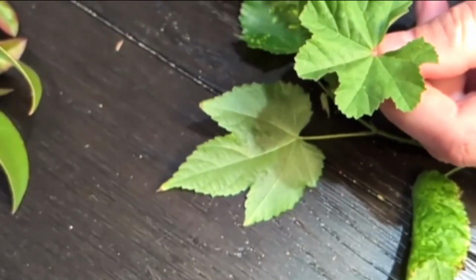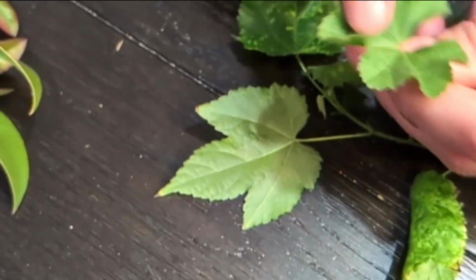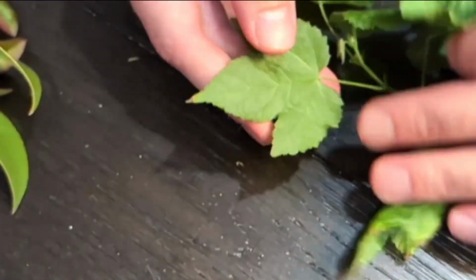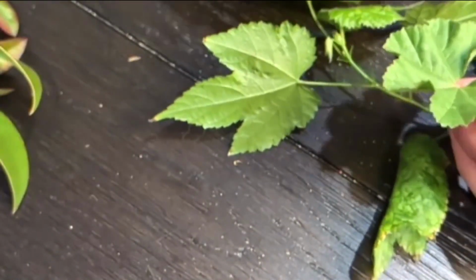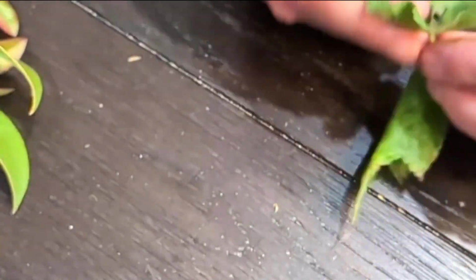It's not compound because the blade, the lamina material, doesn't extend to the center veins. Just like here, they don't extend to the veins. There's blade tissue throughout, meaning they're single leaves. They're not compound leaves, but they do have lobed patterns. And they tend to lobe in a palmate fashion. So those are palmately lobed leaves.